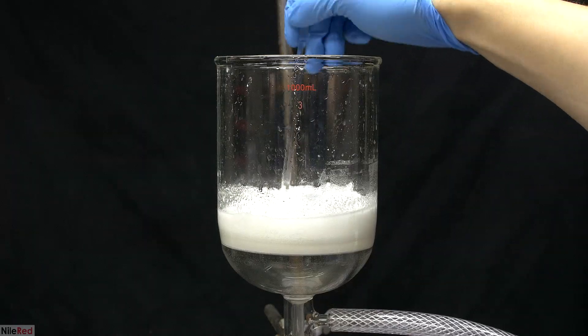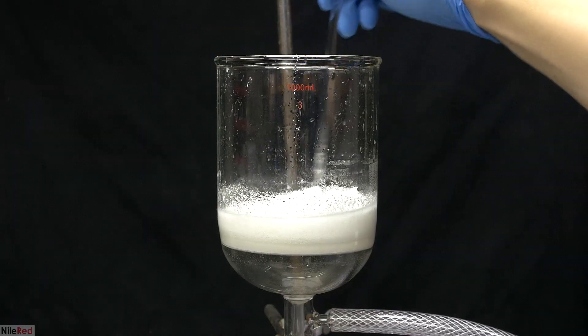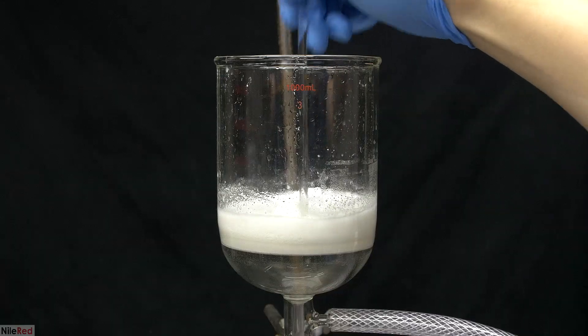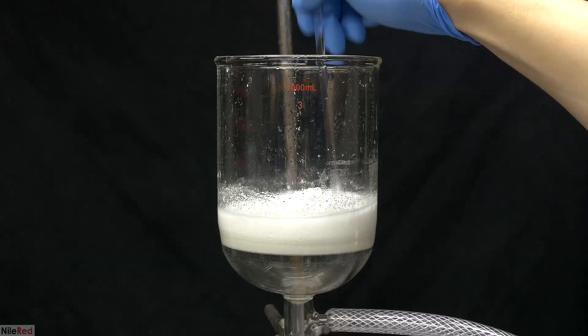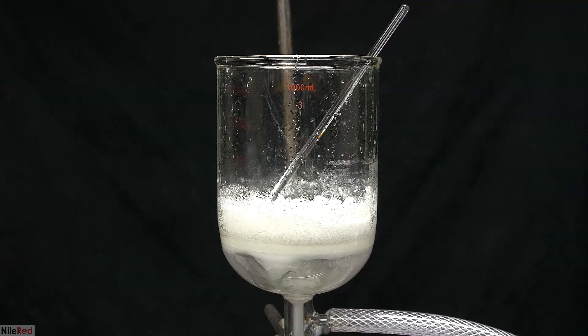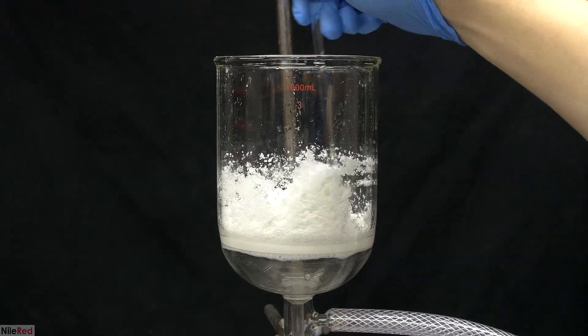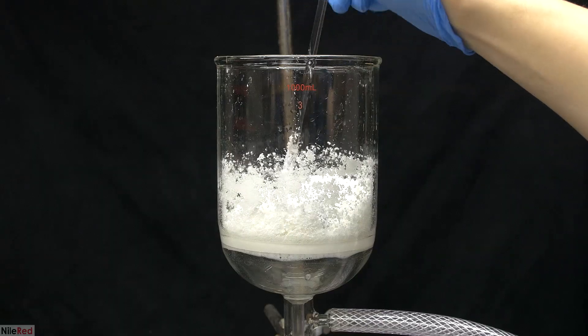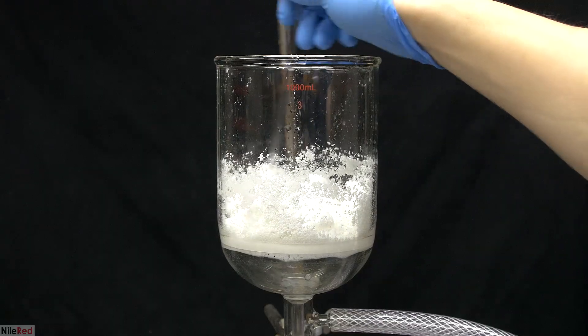I only did one washing step, but in hindsight, I really should have done more, and you'll see why in a few minutes. Once I was done washing it, I left the vacuum pump running to dry it up as much as possible. I was left with some crude and relatively dry adipic acid, which I transferred to a beaker.